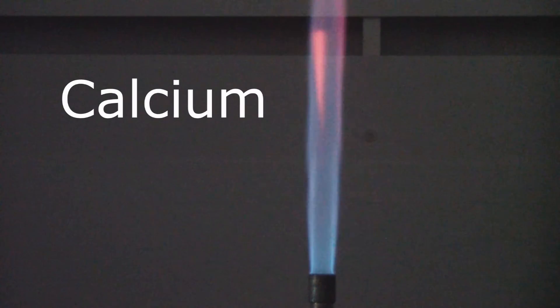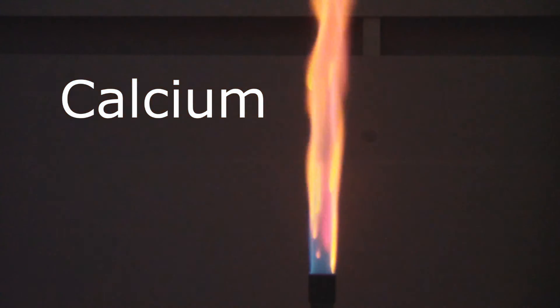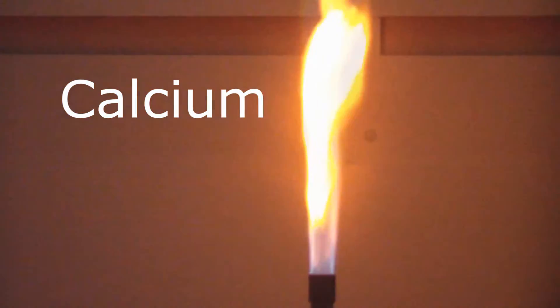The next one is calcium. And we spray that on. We got a little bit more orange, but there's still a little bit of red in that.